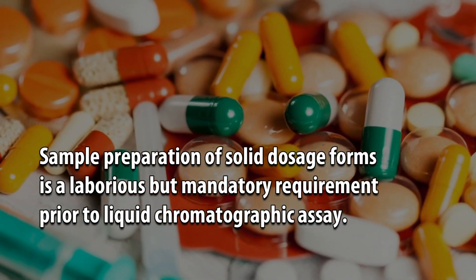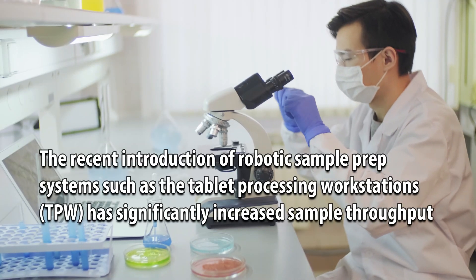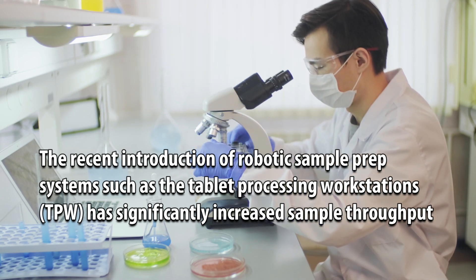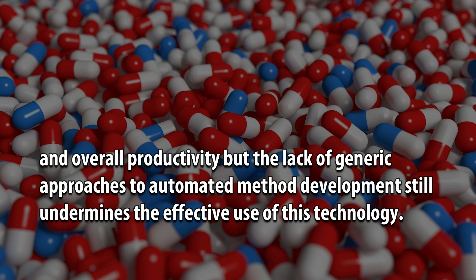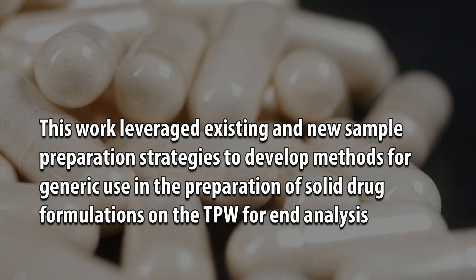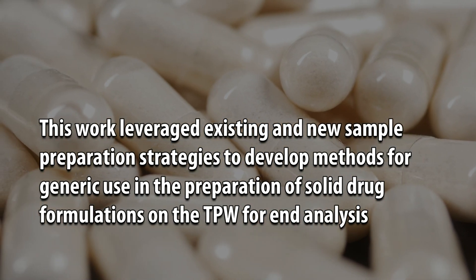Sample preparation of solid dosage forms is a laborious but mandatory requirement prior to liquid chromatographic assay. The recent introduction of robotic sample prep systems such as the Tablet Processing Workstation (TPW) has significantly increased sample throughput and overall productivity, but the lack of generic approaches to automated method development still undermines the effective use of this technology. This work leveraged existing and new sample preparation strategies to develop methods for generic use in the preparation of solid drug formulations on the TPW for end analysis.